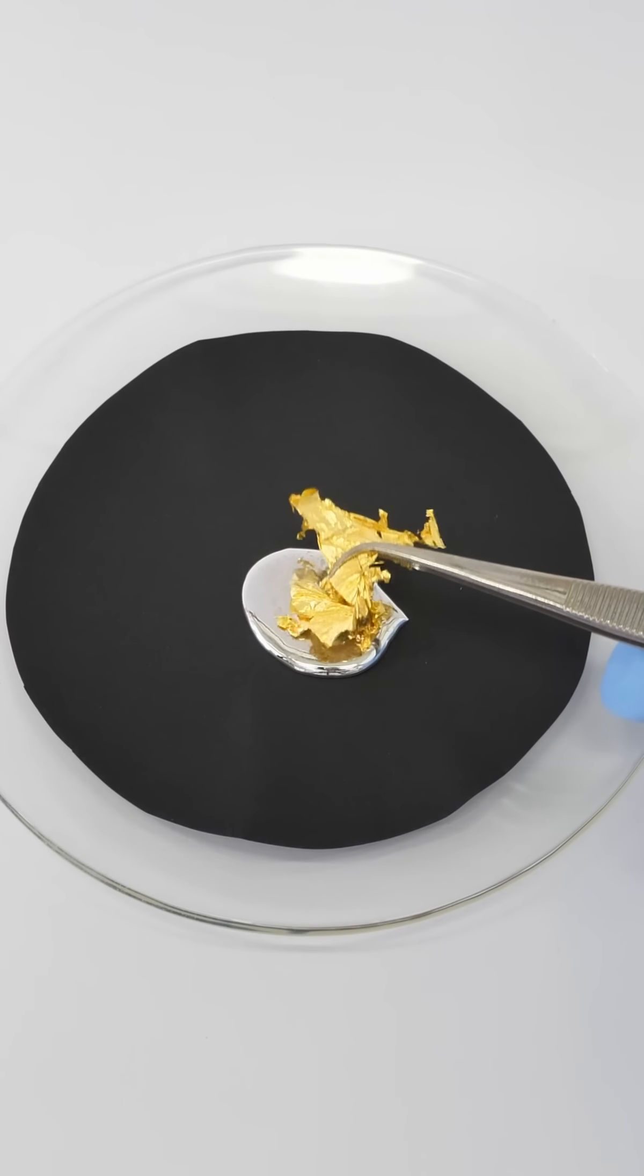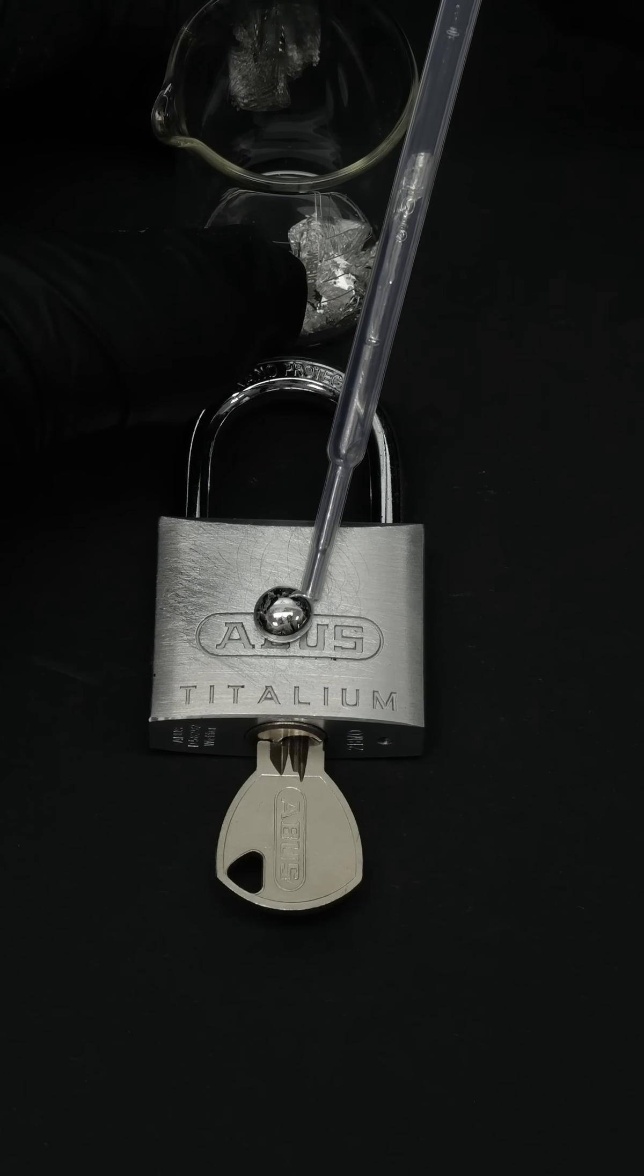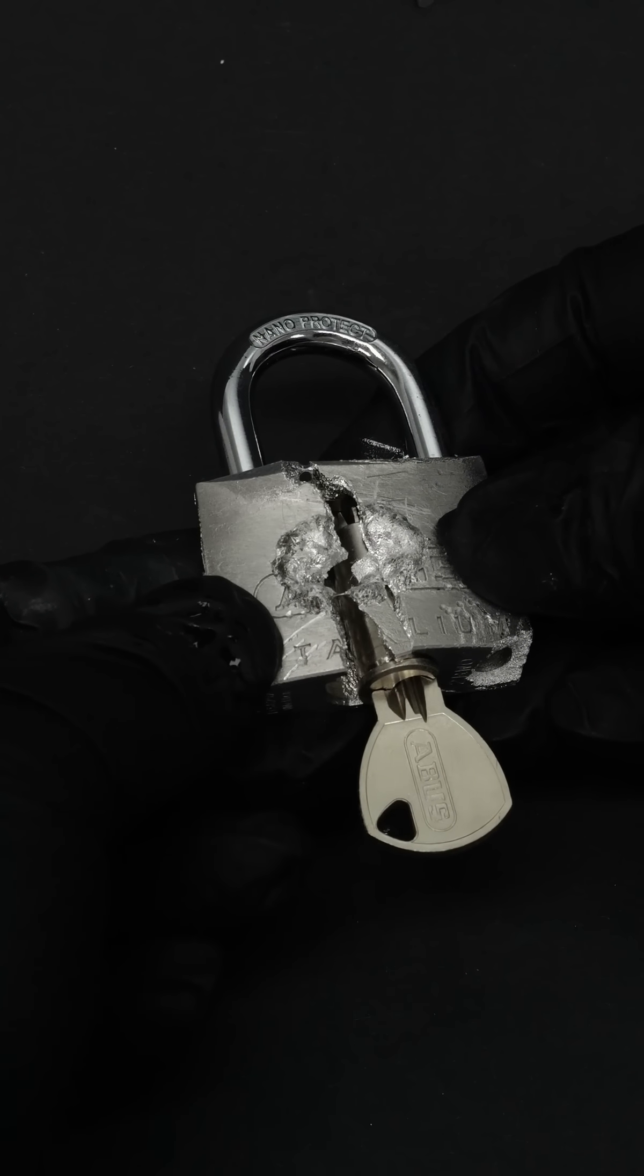Here for example it looks as though the mercury is consuming the gold foil. Or here gallium and aluminum are placed together, making the aluminum extremely brittle.